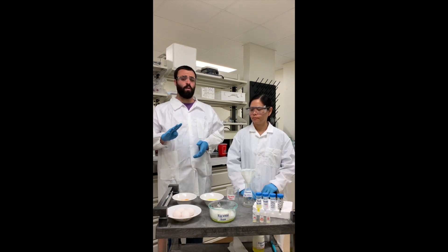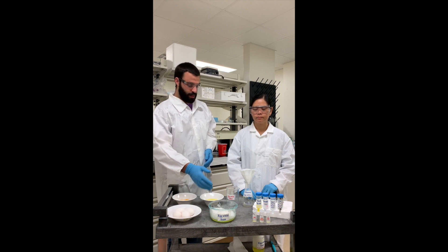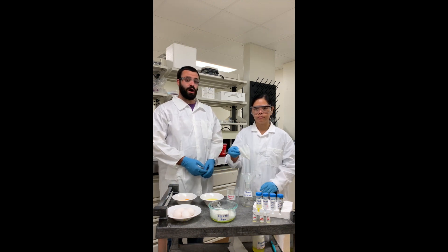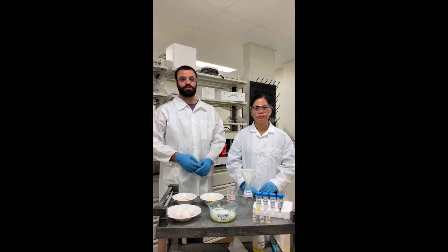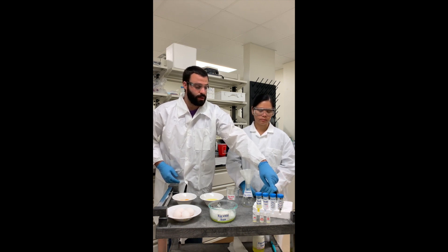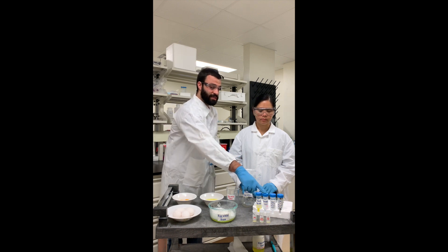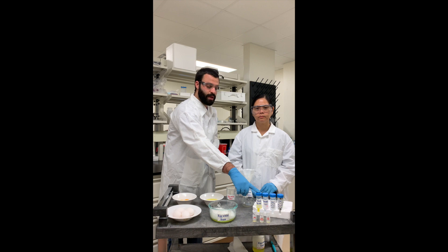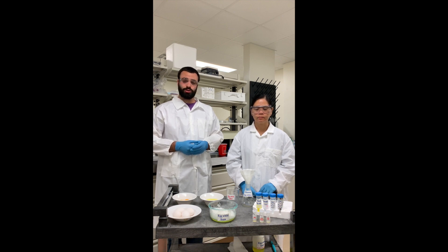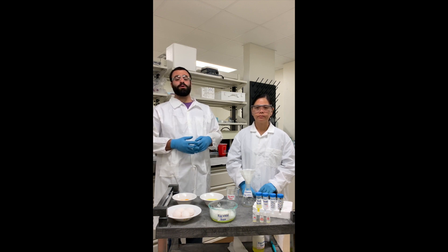It only requires about four or five eggs to prepare samples for an entire class, a glass dish to whisk the eggs in, a beaker, an Erlenmeyer flask, a plastic funnel, a coffee filter, and four test tubes to prepare stock solutions in. Two salt solutions — one being sodium iodide and the other being sodium chloride, with the sodium iodide wrapped in aluminum foil because it's light sensitive — distilled water, and filtered egg white. Each group of students will have three test tubes: one containing no salt, just filtered egg white and water, and the other two containing salts, either sodium iodide or sodium chloride.